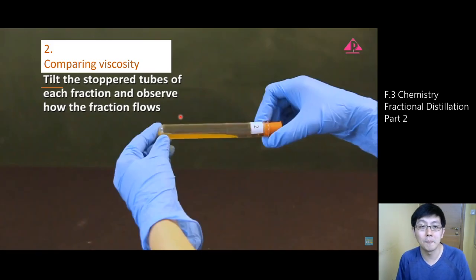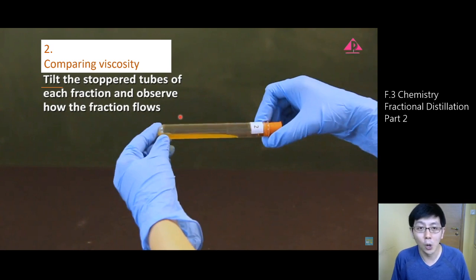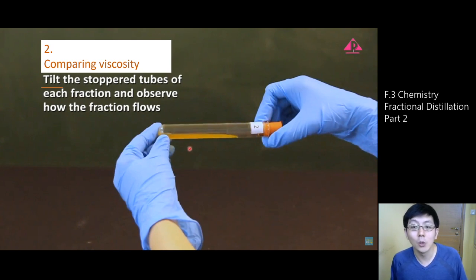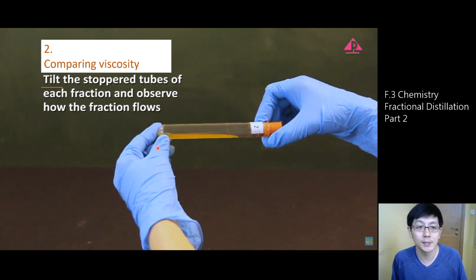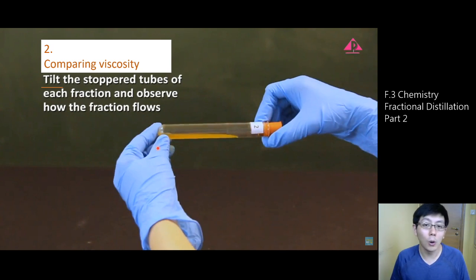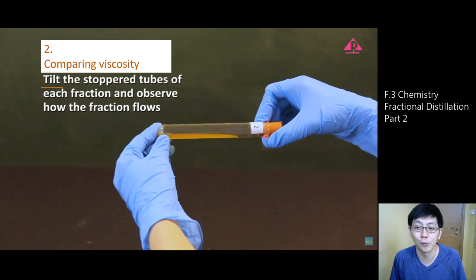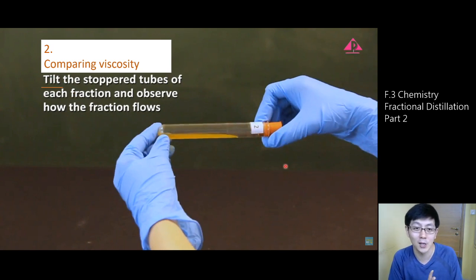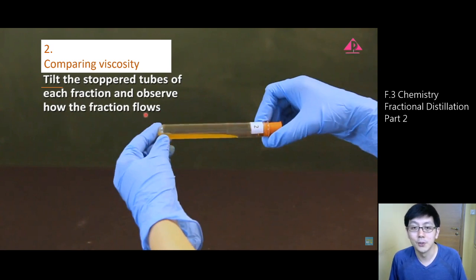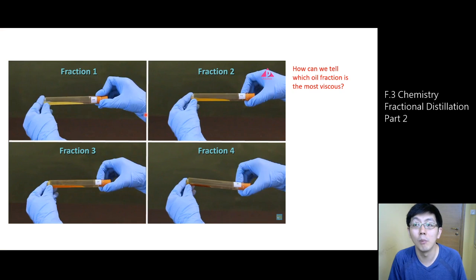Number two: viscosity. Previously I showed you a sample of crude oil and mentioned it is very viscous. To compare the viscosity of different oil fractions, we hold the test tube vertically and then put it in a horizontal position — we call this the stoppered test tube method. You need the stopper; otherwise the oil fraction will flow out, and the contents may be carcinogenic. We observe how the fraction flows.